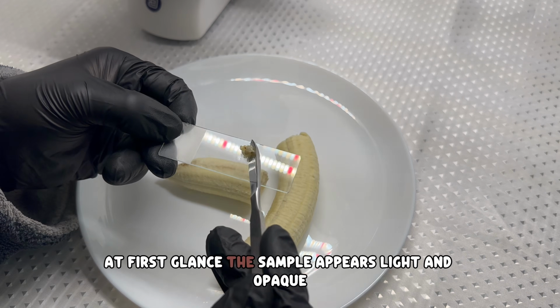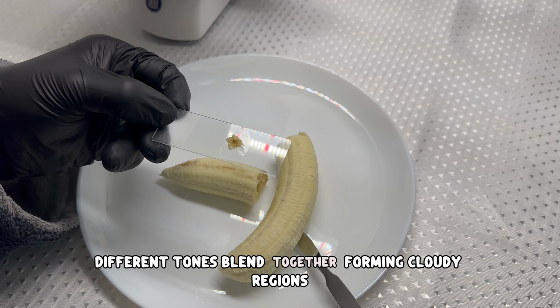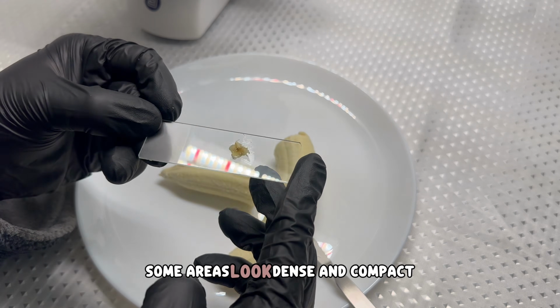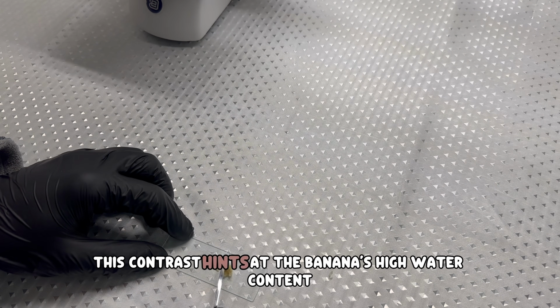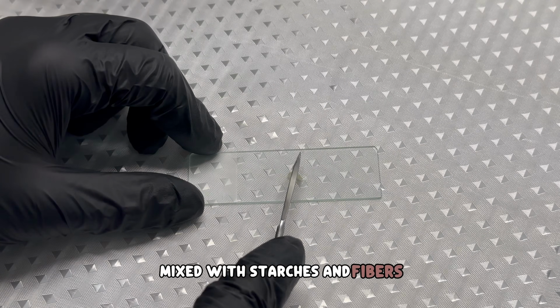At first glance, the sample appears light and opaque. Different tones blend together, forming cloudy regions. Some areas look dense and compact, while others appear more translucent. This contrast hints at the banana's high water content, mixed with starches and fibers.